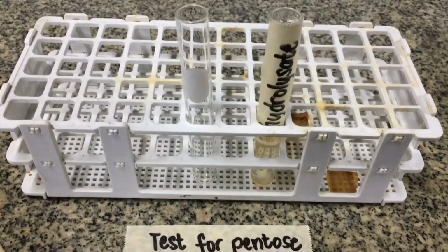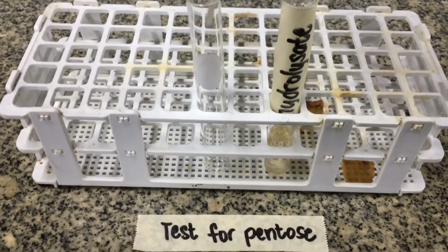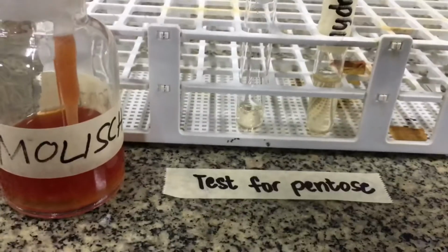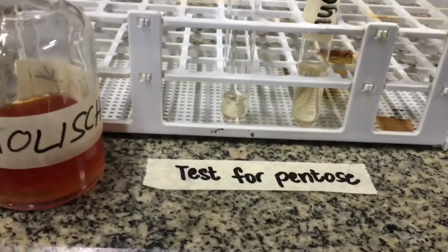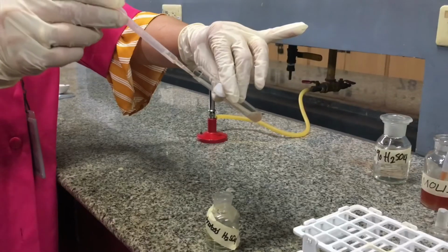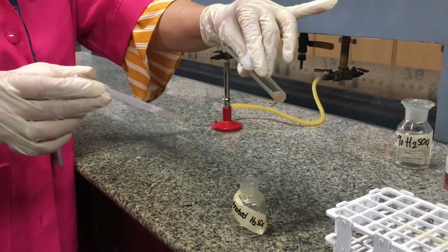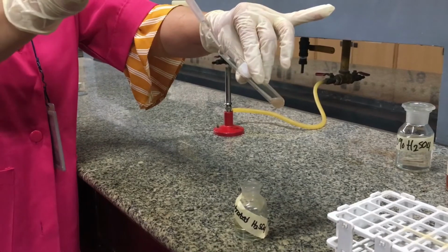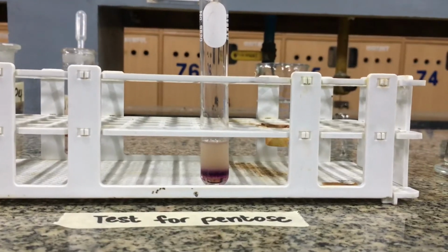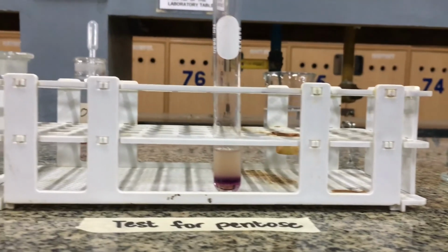Next is the test for the presence of pentose sugar. This is done by placing 1 ml of hydrolysate into a separate test tube. Mix it with 2 drops of Molisch reagent. And then tilt the test tube at a 45-degree angle and superimpose 1 ml of concentrated sulfuric acid along the side. The formation of a purple ring indicates the presence of a carbohydrate. In the case of your nucleic acid, the carbohydrate is in the form of a pentose sugar.